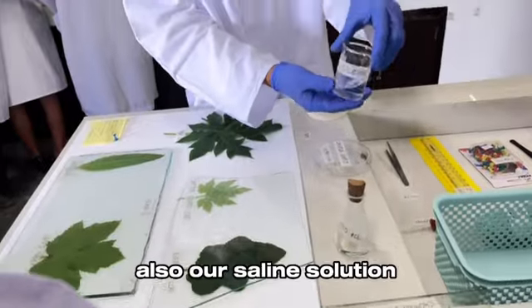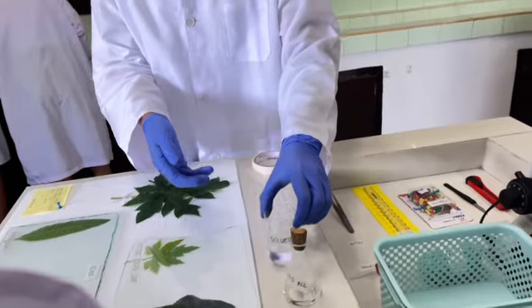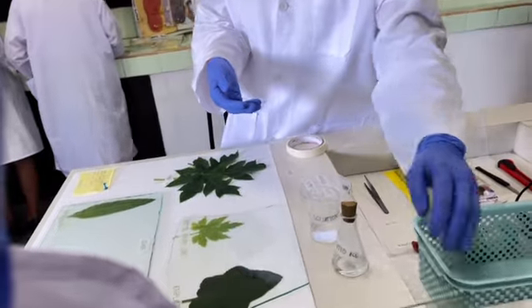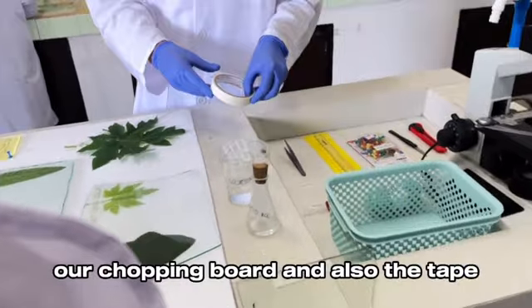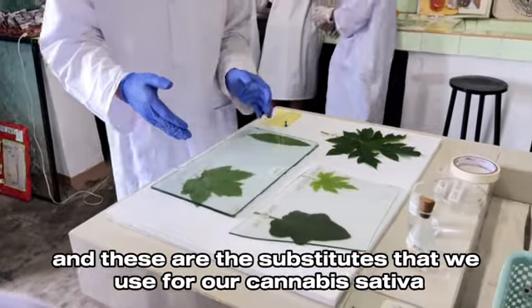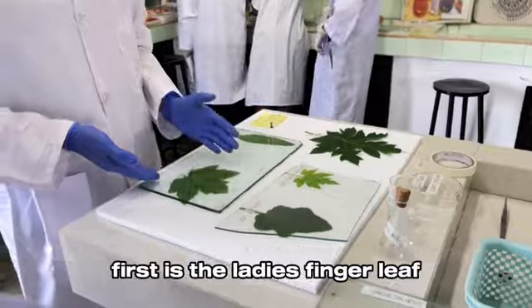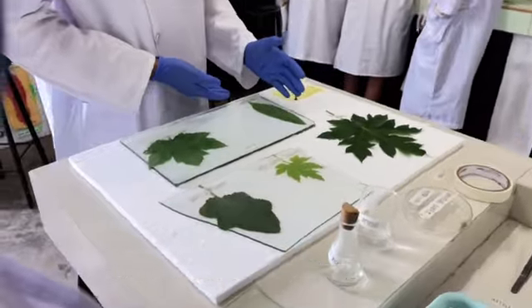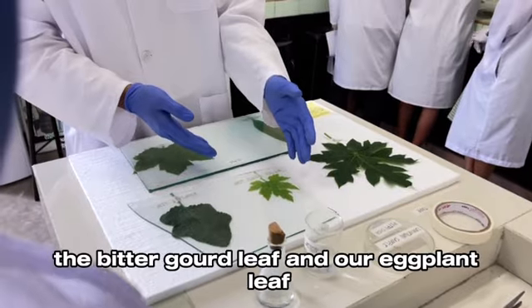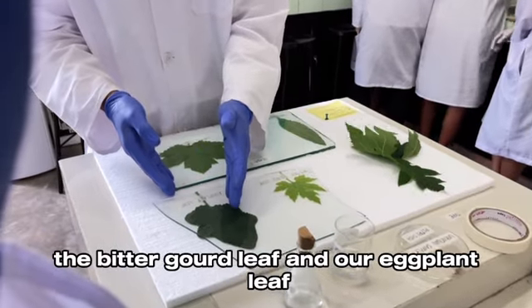Also our saline solution, our diluted HCl, our chopping board, and also the tape. And these are the substitutes that we use for our Cannabis sativa. First is the lady's finger leaf, the camphor leaf, the papaya leaf, the bitter gourd leaf, and our eggplant leaf.